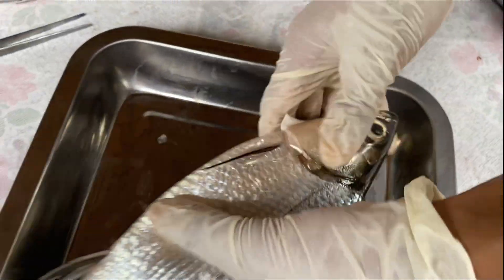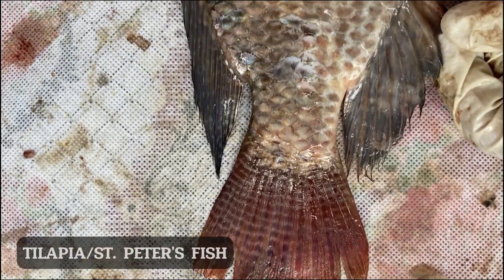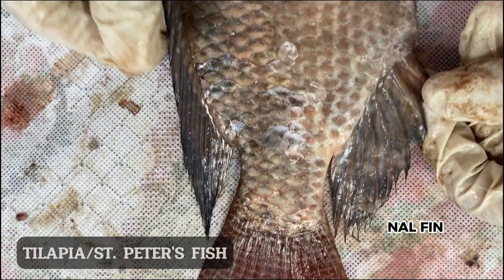Next, we will have a look at the external parts of another fish, starting with the tilapia.